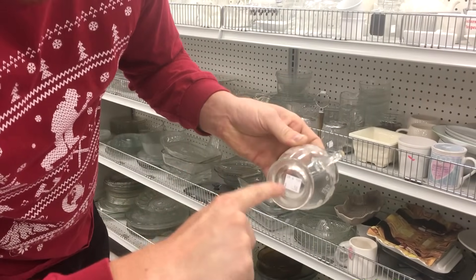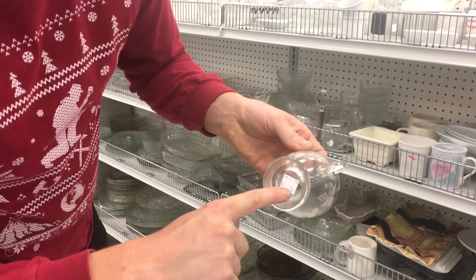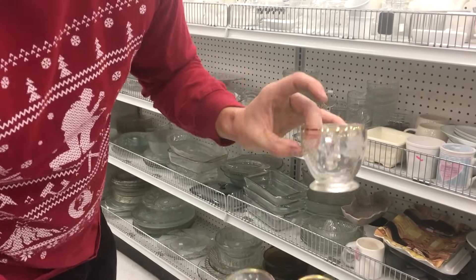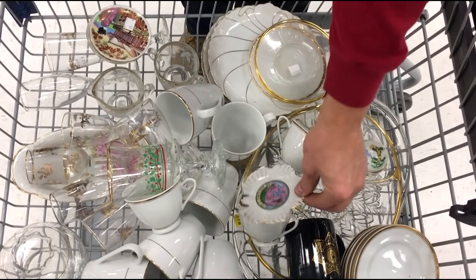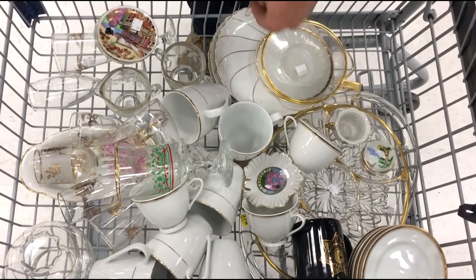I'm absolutely not going to get more gold out of it than this is going to cost me, but you guys get the idea. So here's what we've picked up around the place. Let's go see if we can get the gold off.